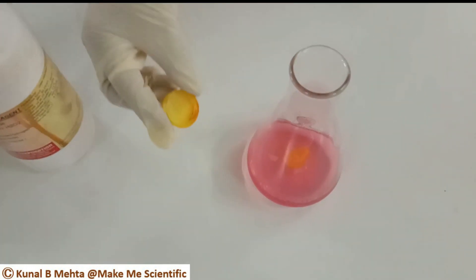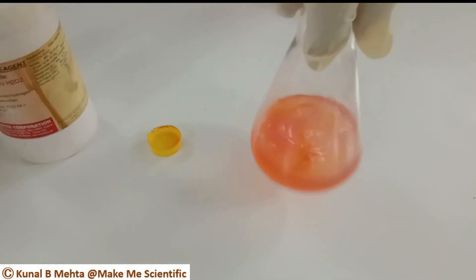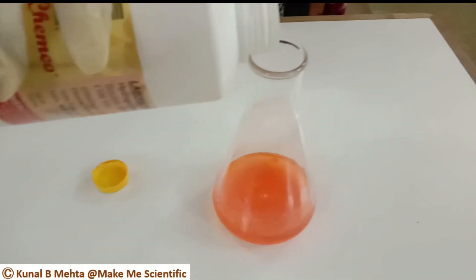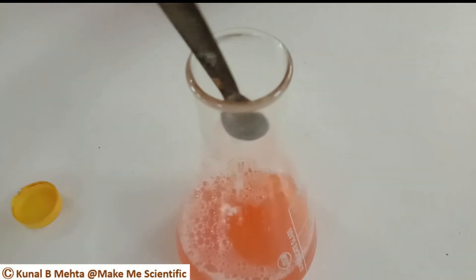Please make sure that whenever you are adding any components, you should shake the mixture well. You can see that the reaction has started to occur — the elephant toothpaste has started to rise. Wow!